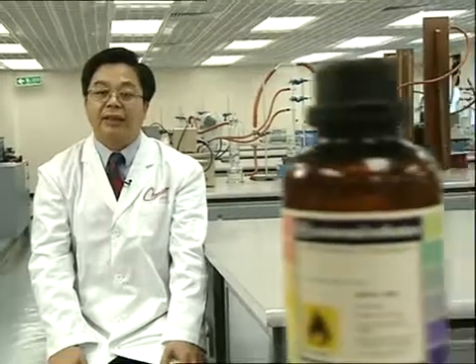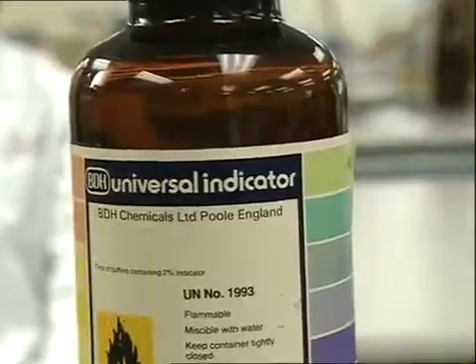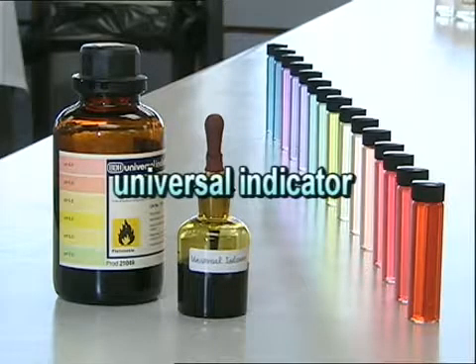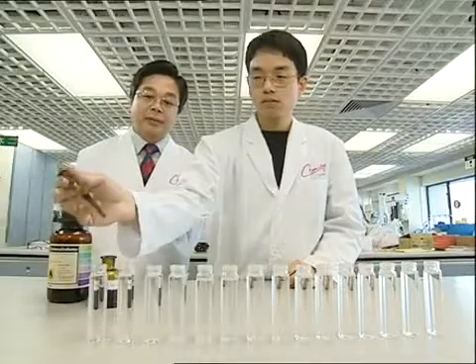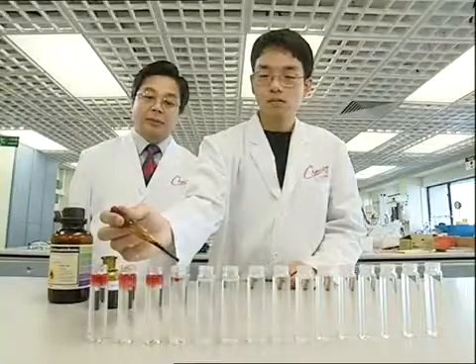We have to use other indicators to check the degree of acidity or alkalinity. This is the universal indicator. It's a mixture of several indicators. We can add drops of the universal indicator to solutions with different degrees of acidity and alkalinity and observe the change in color.